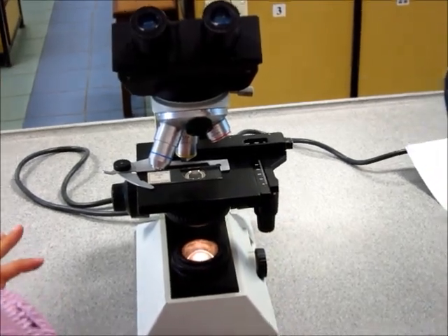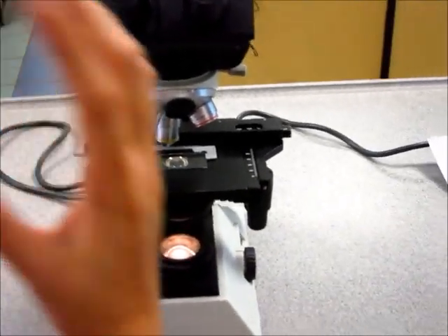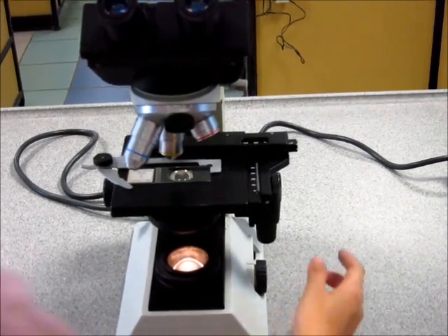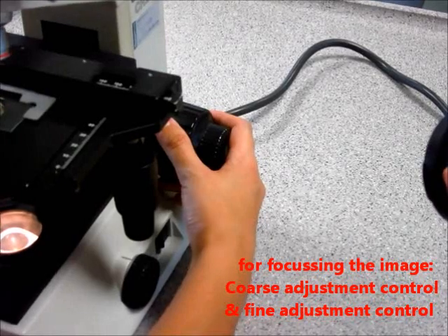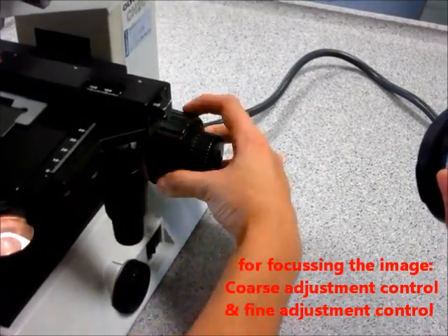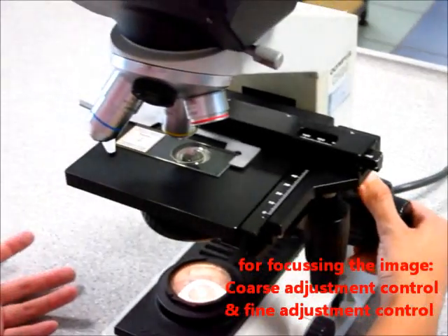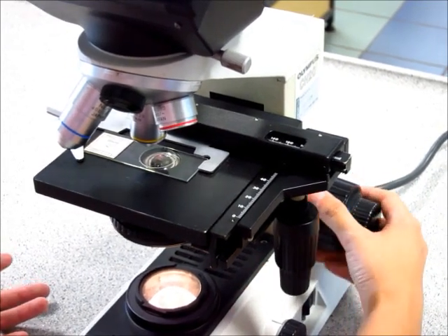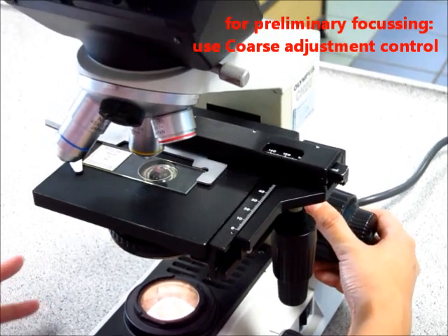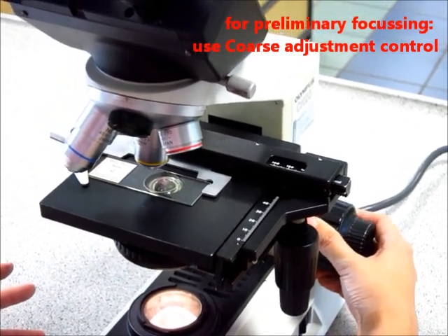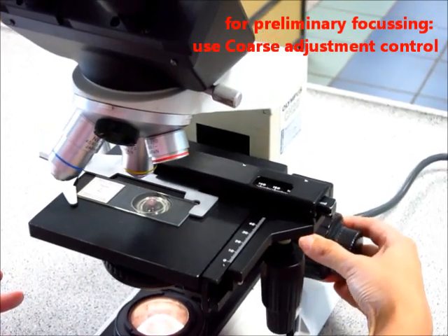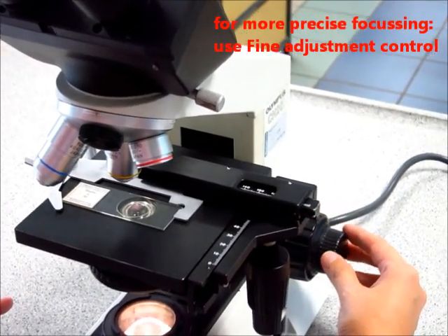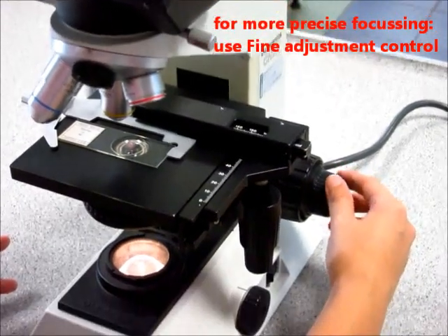Now the next few things I'm going to show you are pretty important. These are the main knobs that you will be fiddling with when you are trying to see something underneath the microscope. The first involves the magnification and the focus. If you turn the big knob over here, this is the coarse adjustment knob. If you turn this, this is the fine adjustment knob. Now the difference is that for the coarse adjustment knob, it moves the stage a lot. But if I turn the fine adjustment knob, it's a very fine movement of the stage, so little that you can't really see anything.